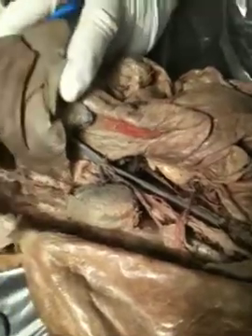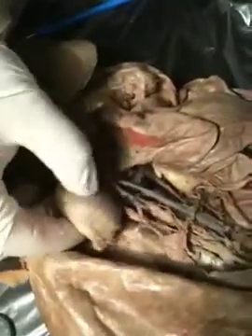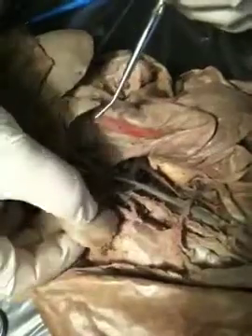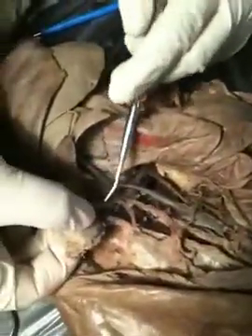We're looking at the inferior vena cava that runs along the major part of the vertebral column. And as you can see, you have the right kidney protruding from there, and you have the renal veins, which are two.